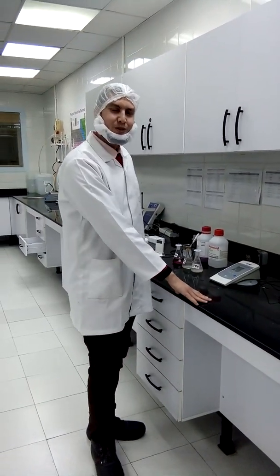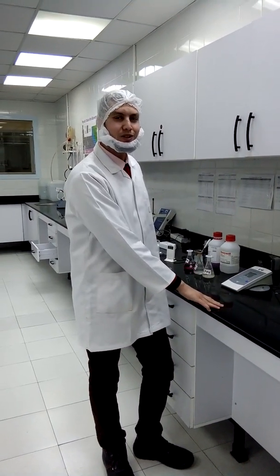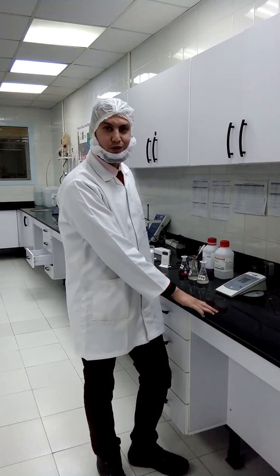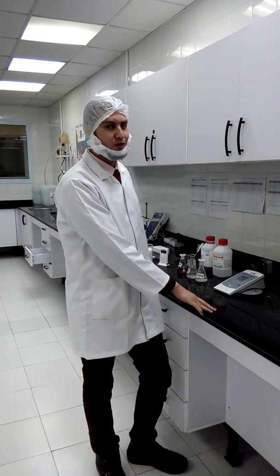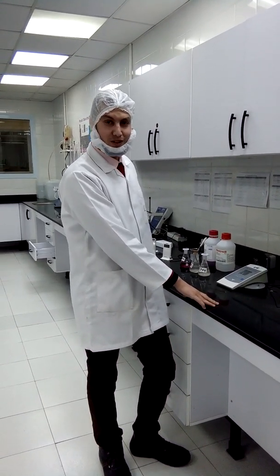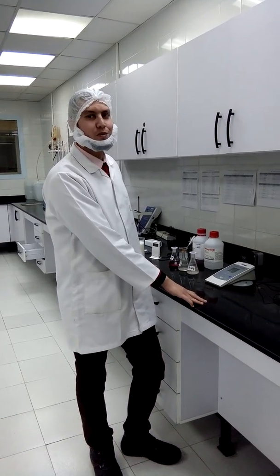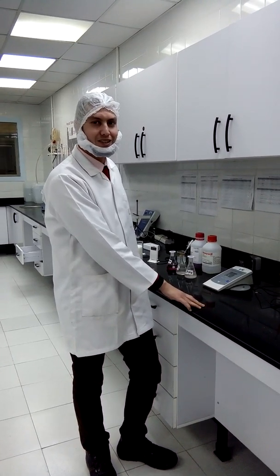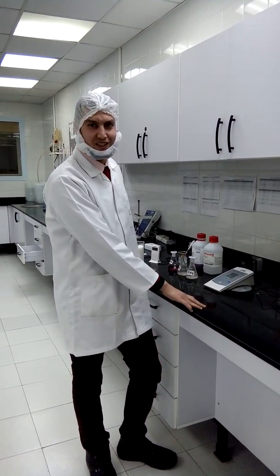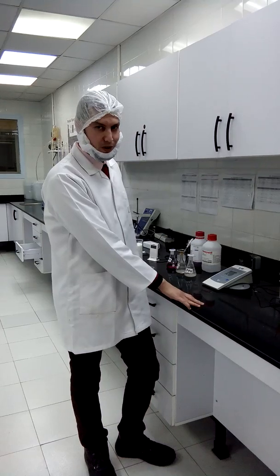Welcome! Today we will be talking about pH. pH refers to the power of hydrogen, or the potential of hydronium. The pH meter is used for measuring acidity degree from 0 to 14, and 7 is neutral.